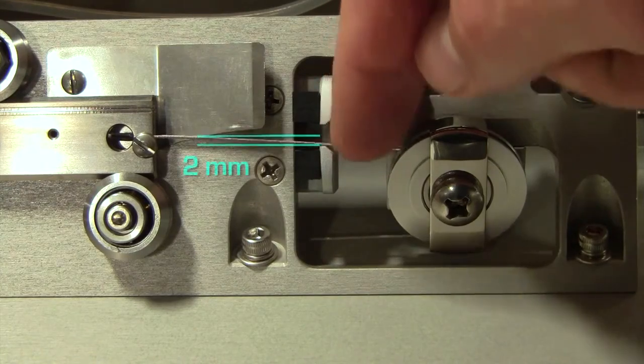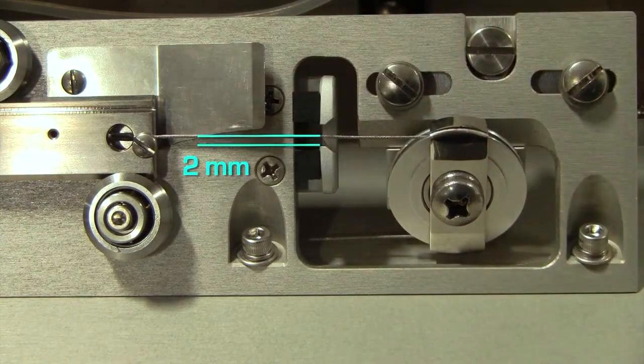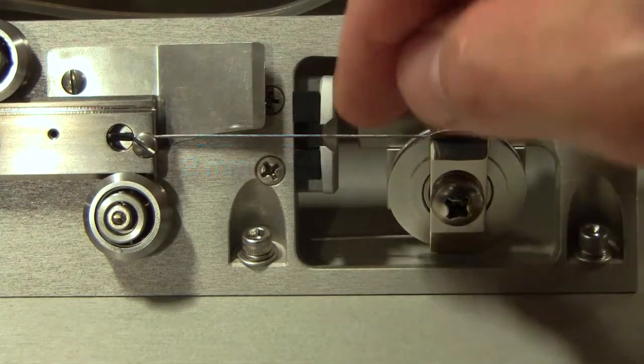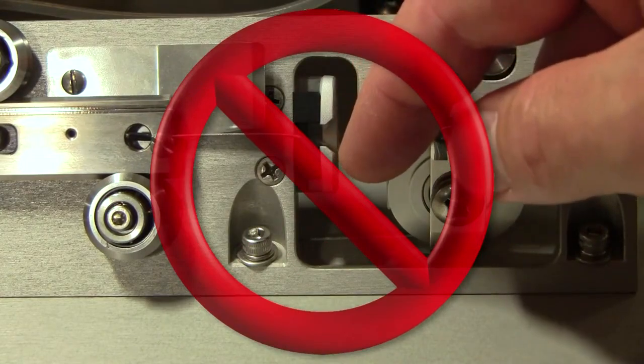The cable should have about 2 mm of play. In other words, you should be able to push the cable roughly until it sits on the bottom of the cutout in the bumper. Do not use too much force and make a kink in the cable.